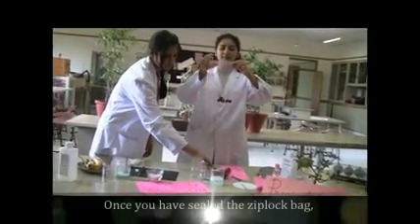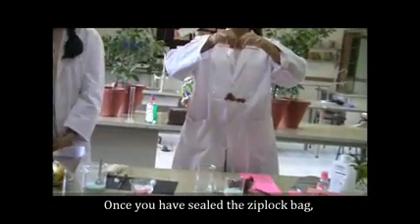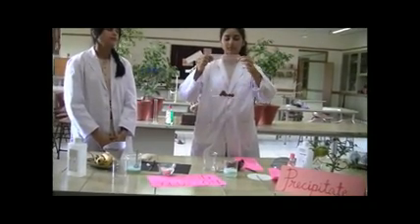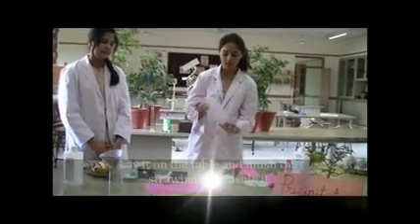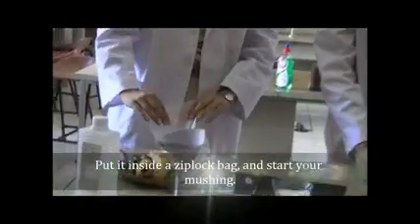Once you have sealed the Ziploc bag, mash the strawberries inside it. You do the same in the lab method. You take a banana, cut it and put it inside a Ziploc bag and start the mushing.